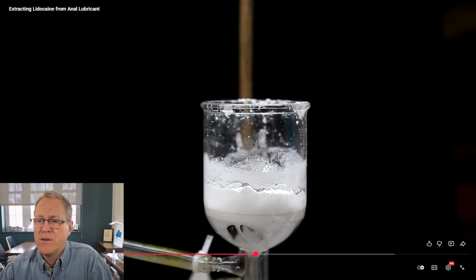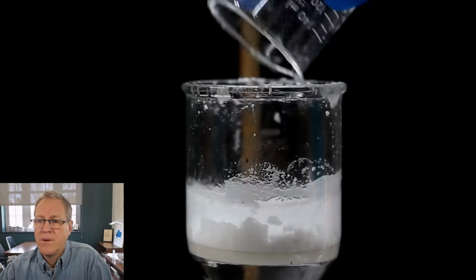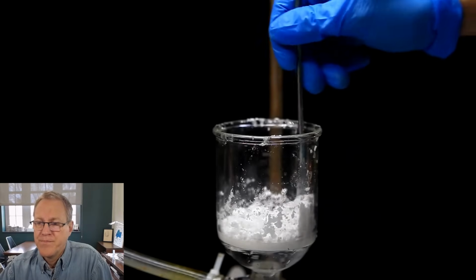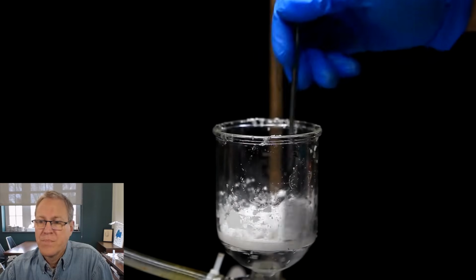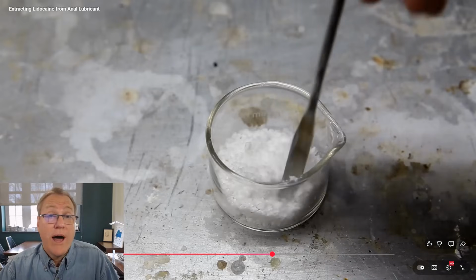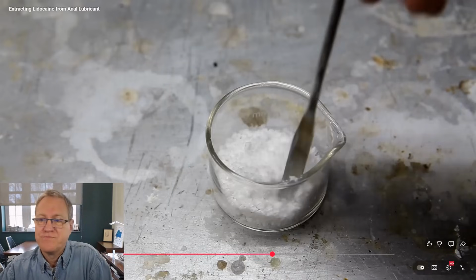After I think I've done a decent washing job, I vacuum off the water. Then, more water is added, and I keep repeating this until I feel it is clean. After several water washings, you can see that although it's still not perfect, it's a lot more powder-like than before. There are some little bits that stick together, but overall I would consider this a powder. Okay, I agree that it progressively improved. And so, again, is it perfect? No, but is it good enough to carry on? And he's made that decision, looks good enough.